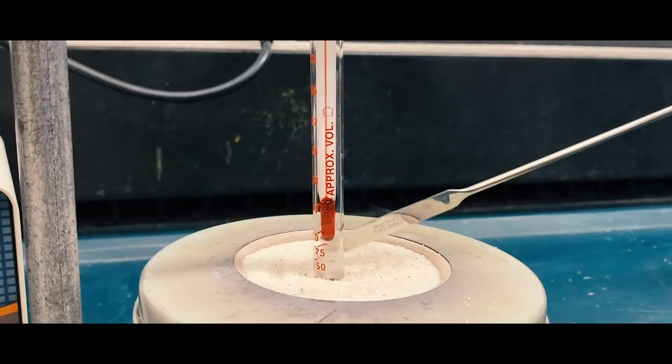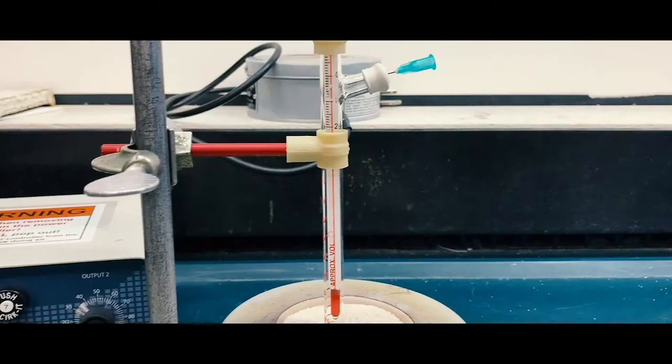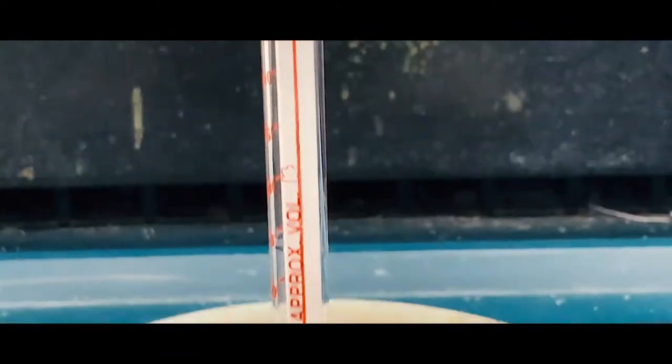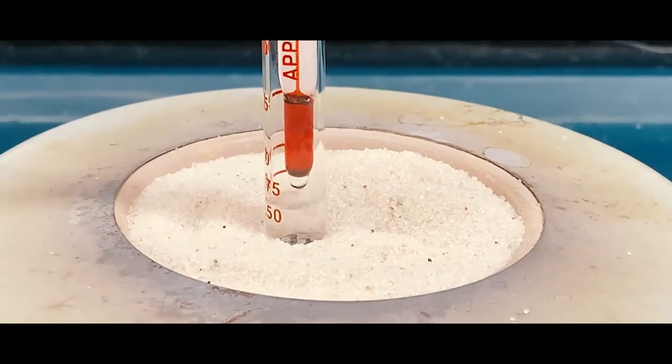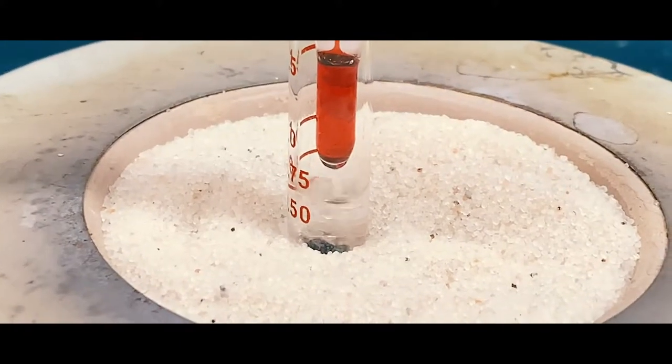Move the sand if the liquid is boiling very fast. Here you can see the liquid has started condensing from the tip of the thermometer. Record this temperature.